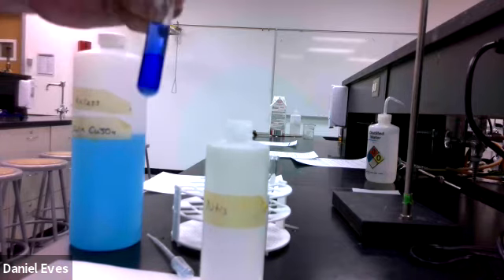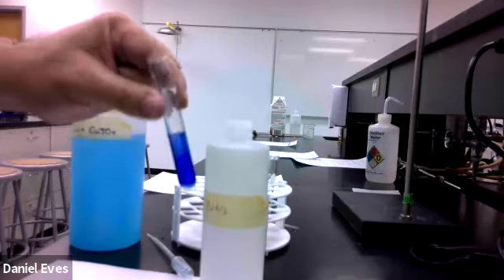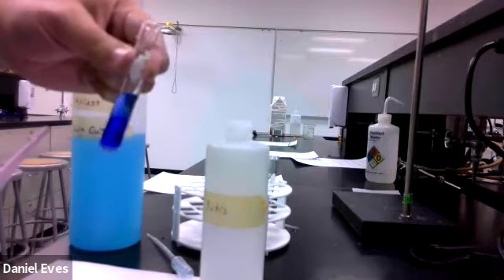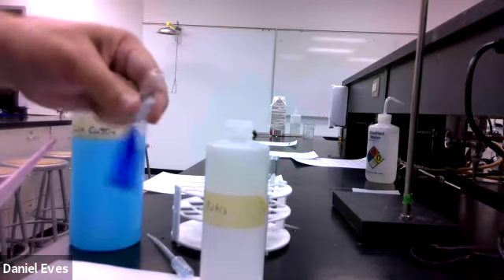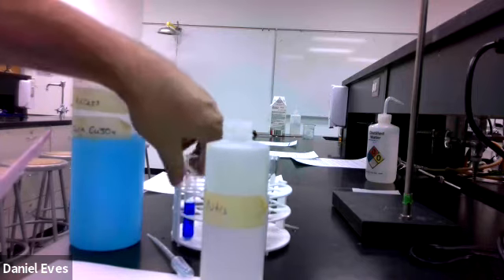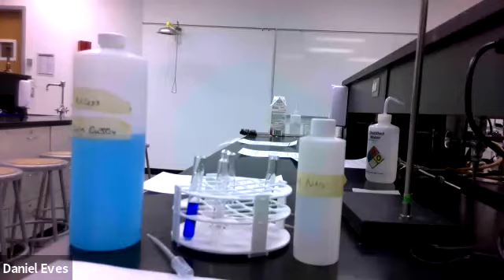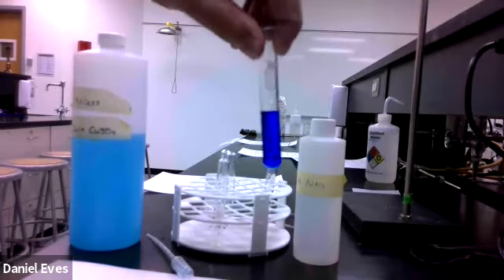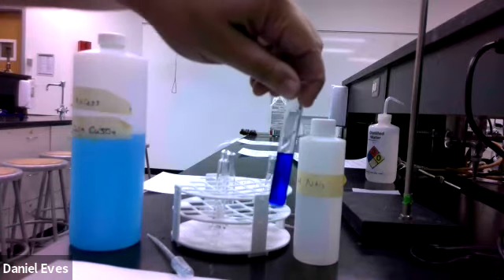So there we go. Oh, we're starting to get some differentiation there. Starting to be a solid forming there at the bottom. And then we have this dark blue liquid there. So let's go ahead and mix this around. And then we'll let it sit for just a minute and we'll come back to it. Okay, so we've let this solution sit for a minute. We can see the 2 layers, hopefully. There is a solid at the bottom that's a little bit white.